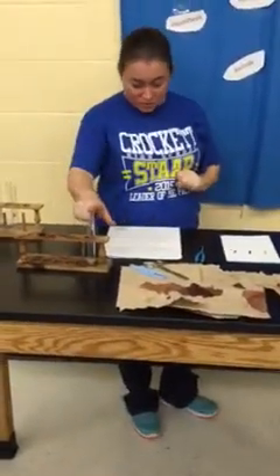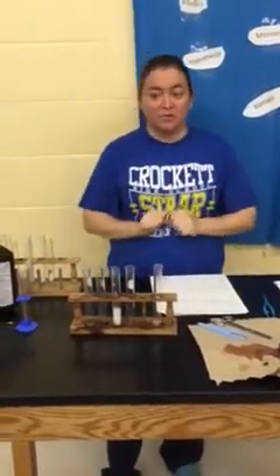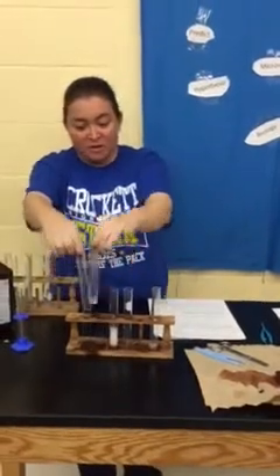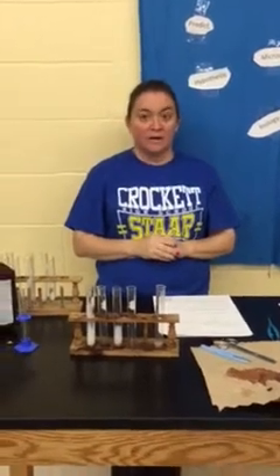While that's cooling, we're going to move on to the next two — the warm water bath and the cold water bath. The directions say to take the peroxide and pour it into the liver and observe the reaction on a scale of zero to five. I'm going to do the warm one first, then take the cold one and observe the reaction — again, zero to five.